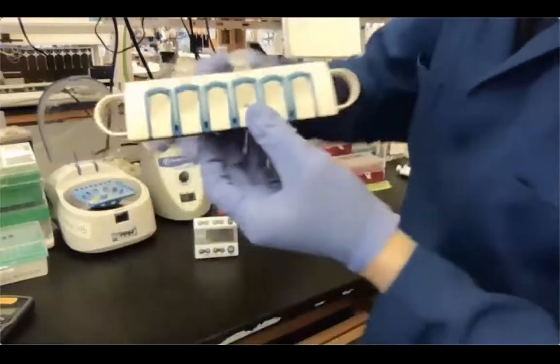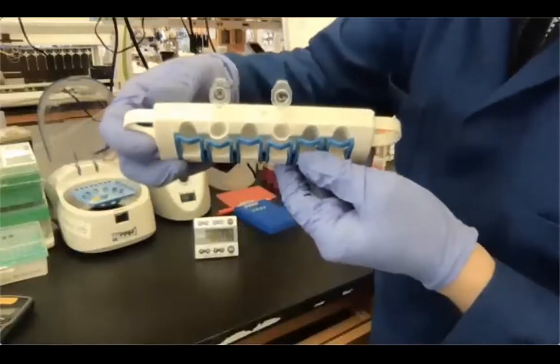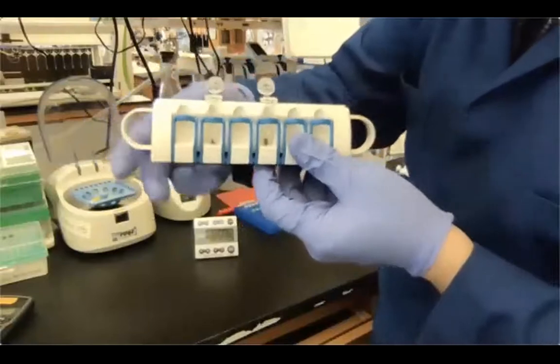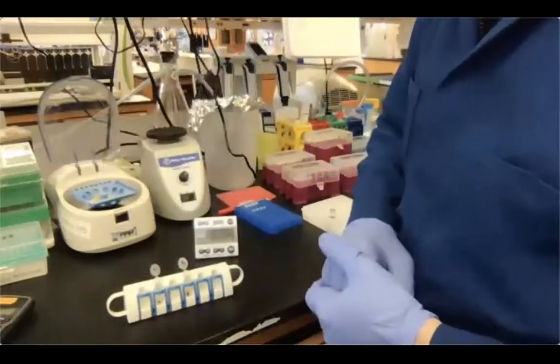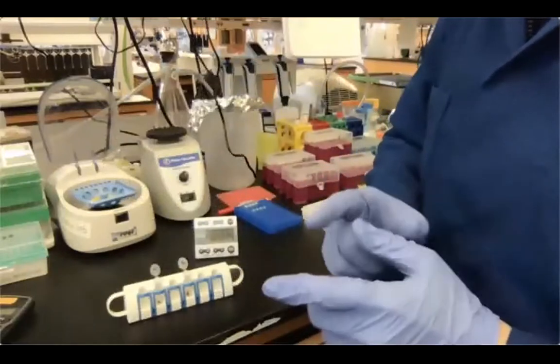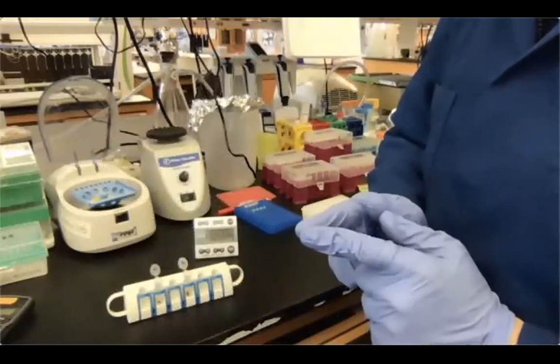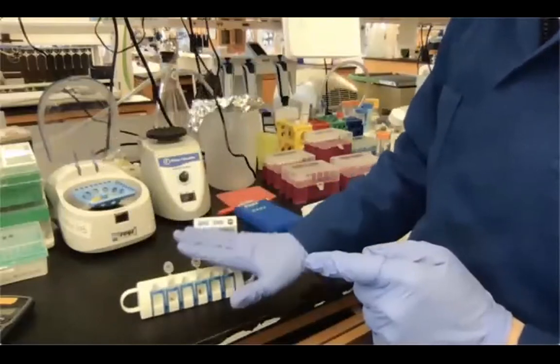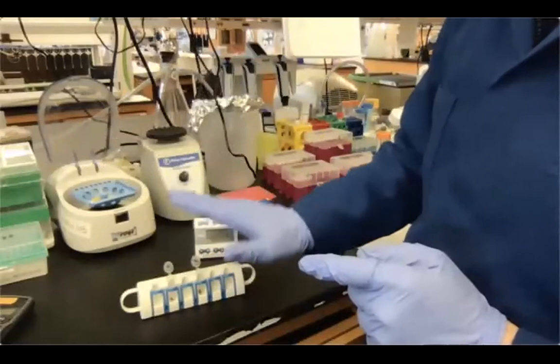And as you can see, the bead pellets are still there. Okay, and the ethanol is here. We incubate for about 30 seconds, and then we are able to remove the supernatant. One thing that is different between the supernatant removal of our first step and this one is that now, when the 80% ethanol is there, the bead pellet is strongly attached to the magnet.